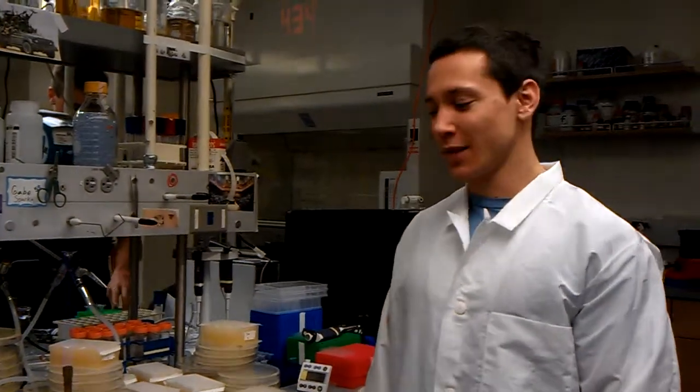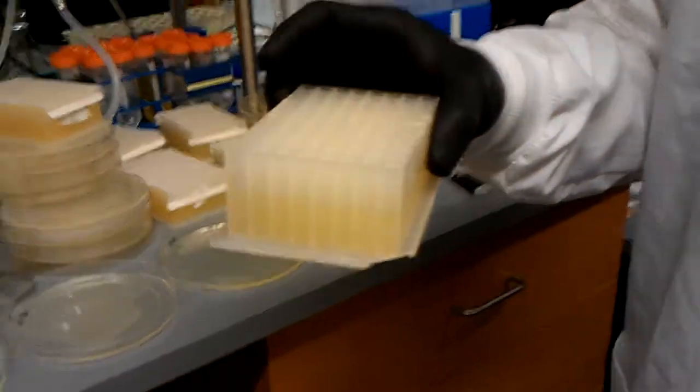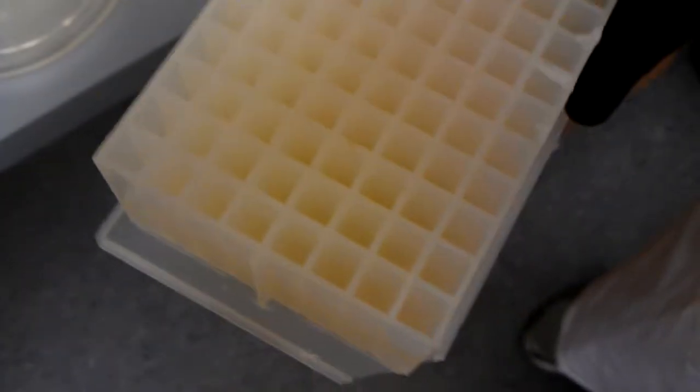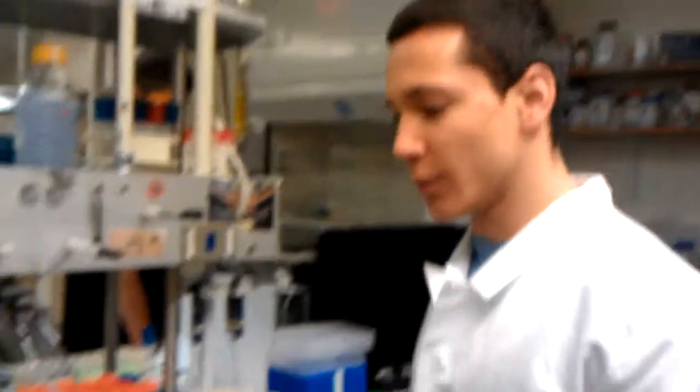We're going to be finishing up our screen. We have our 96-well block which has been shaking in the incubator for five hours. And I just wanted to quickly show you how to spot little colonies using a 96-well pin tool.